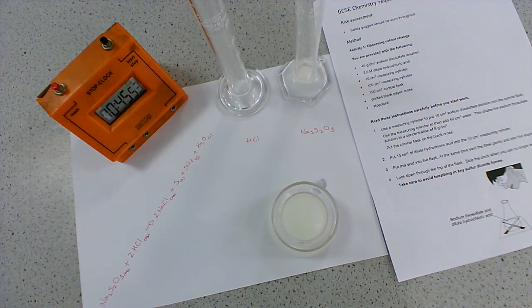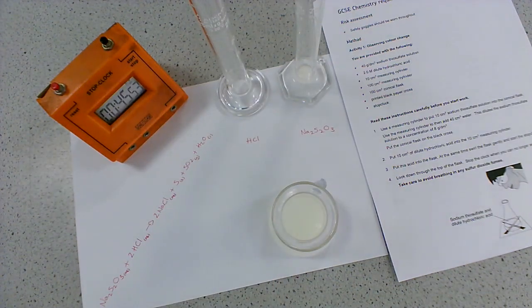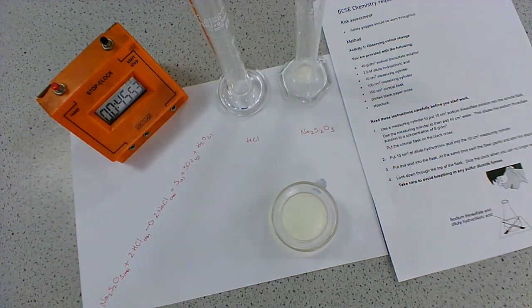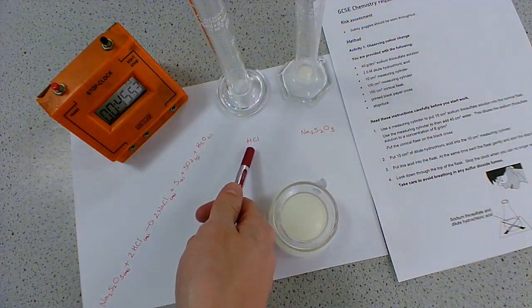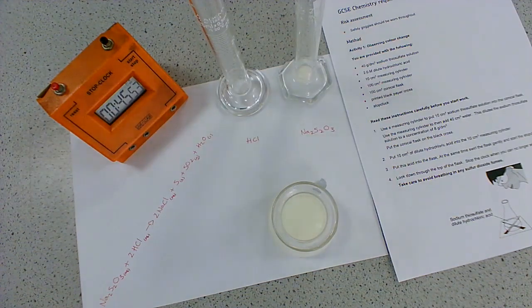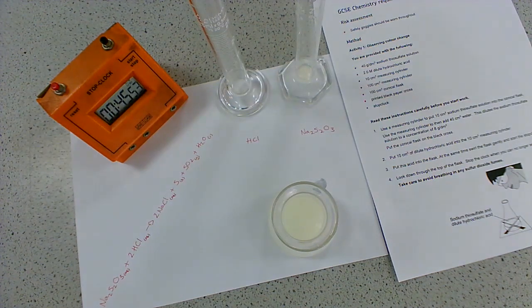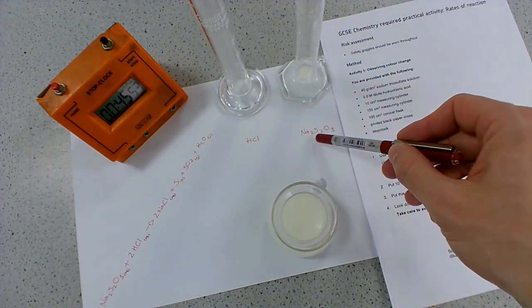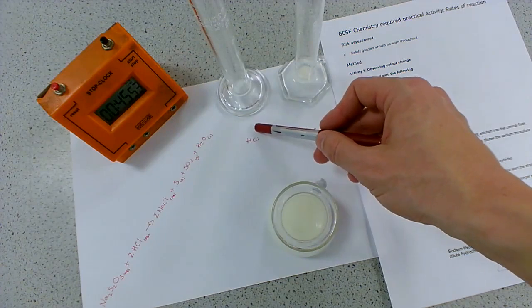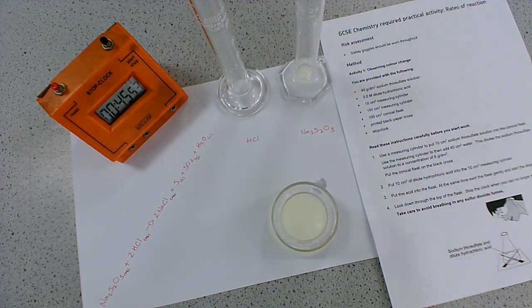What is important is that everything else remains the same. I used 25 cm³ of hydrochloric acid and 25 cm³ of sodium thiosulfate - it's important we use the exact same measurements each time. I used 0.1 mol/dm³ hydrochloric acid, so next time I need to use the same concentration of acid. You should only ever be varying one thing - one independent variable. In this practical, we are varying the concentration of the thiosulfate, keeping the same volume of both and the same concentration of the hydrochloric acid.